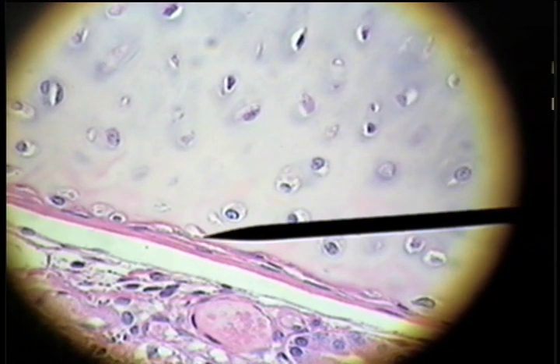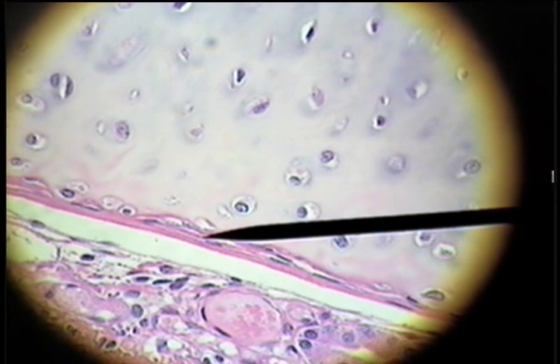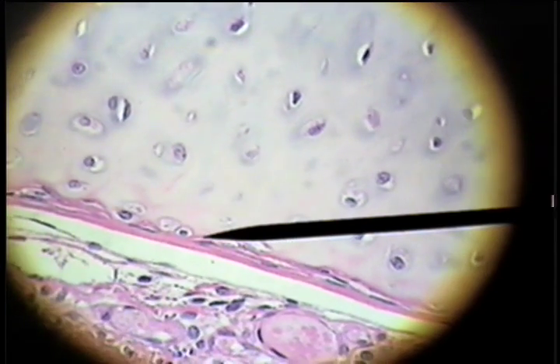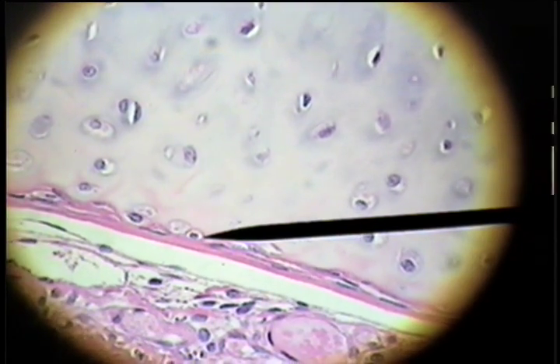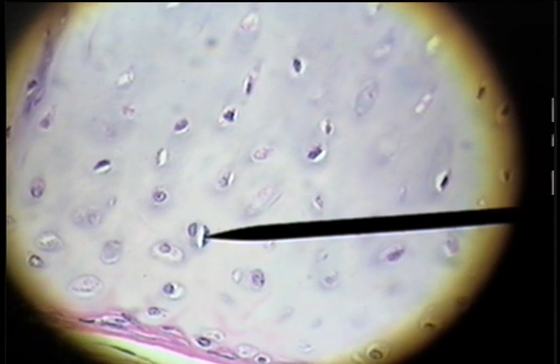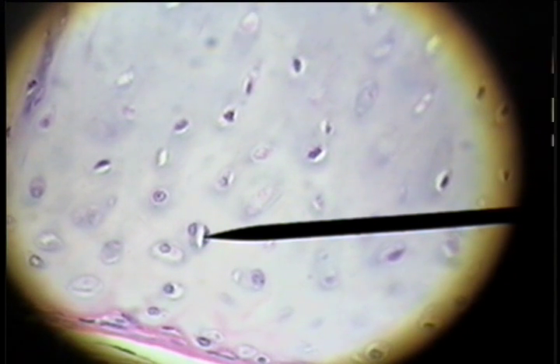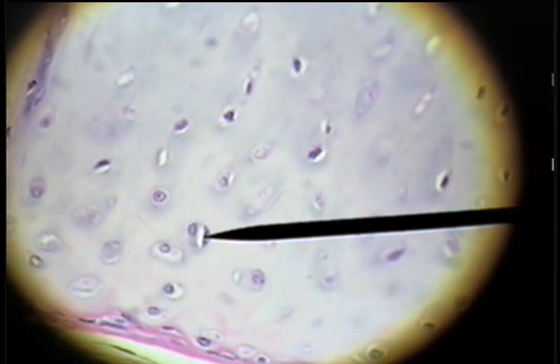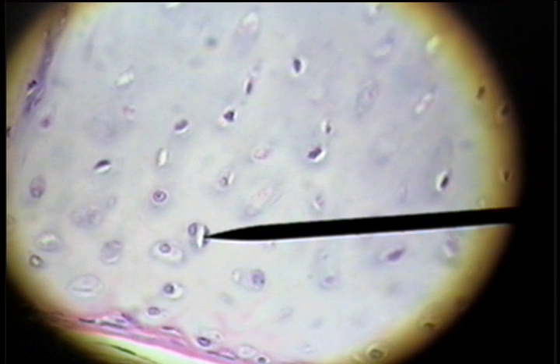On the opposite surface, the fibrous perichondrium again with the chondroblasts on the periphery, and then the adult chondrocyte located in the ground substance of hyaline cartilage.